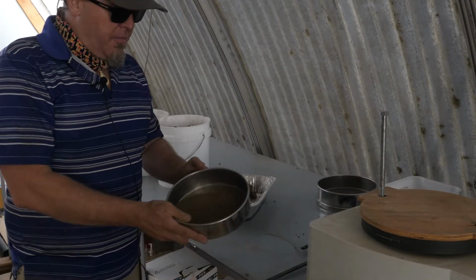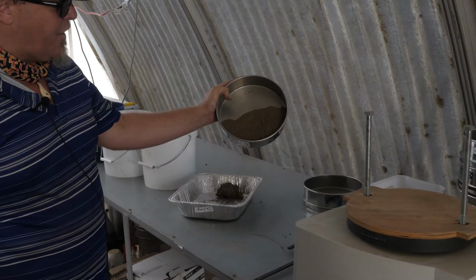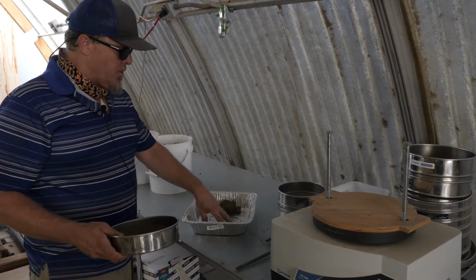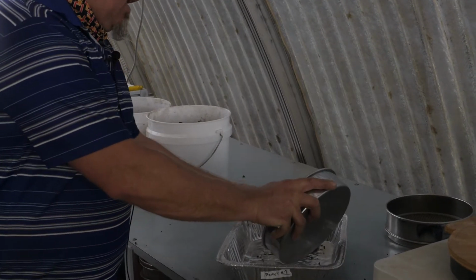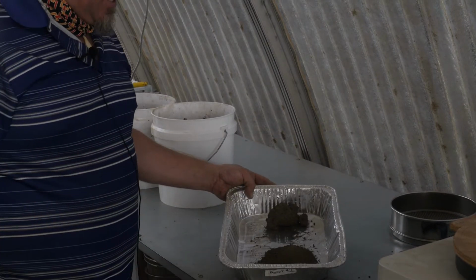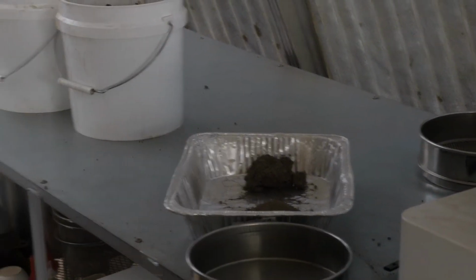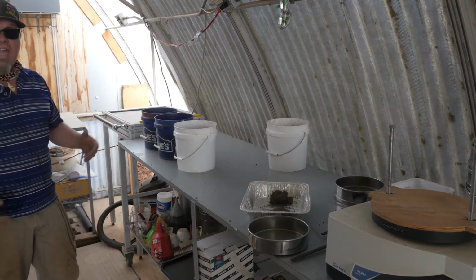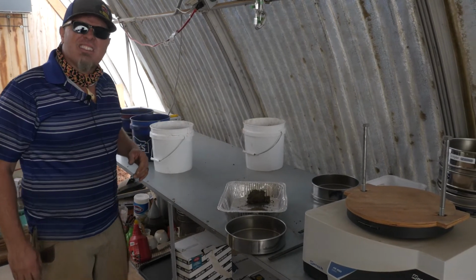All right, now we have a nice pan of 2 millimeter or finer fine fraction soil. And we're going to put it in this tin so we can give you an idea of what it looks like between the nice aggregated soil and the fine fraction soil that we've made through physical fractionation. We're going to keep going. We're going to sieve out the rest of these buckets. Here's bucket number 1. And then we're going to sieve out the rest so we have enough sample to work on over the rest of today and over the next couple episodes.